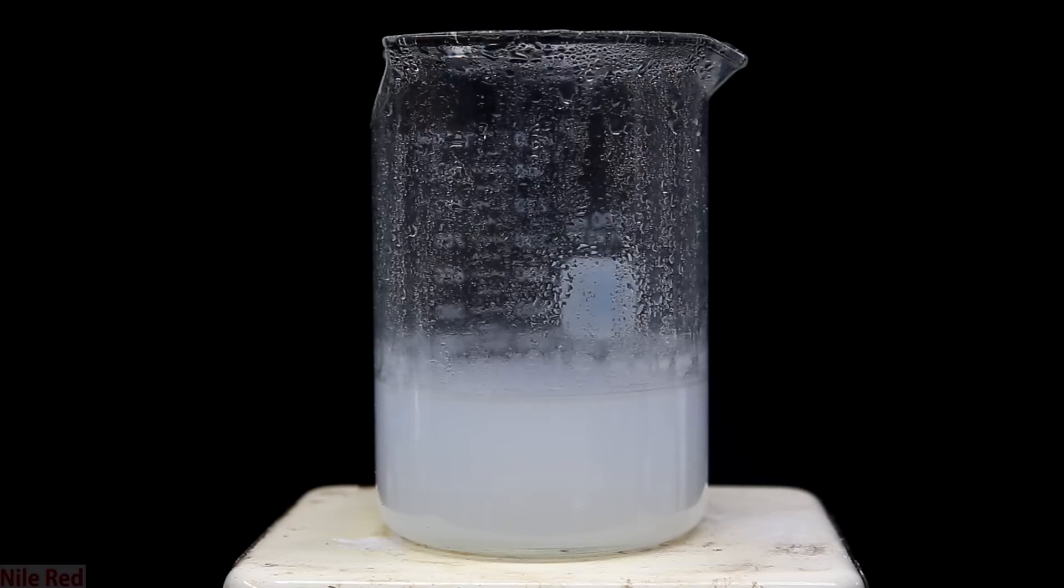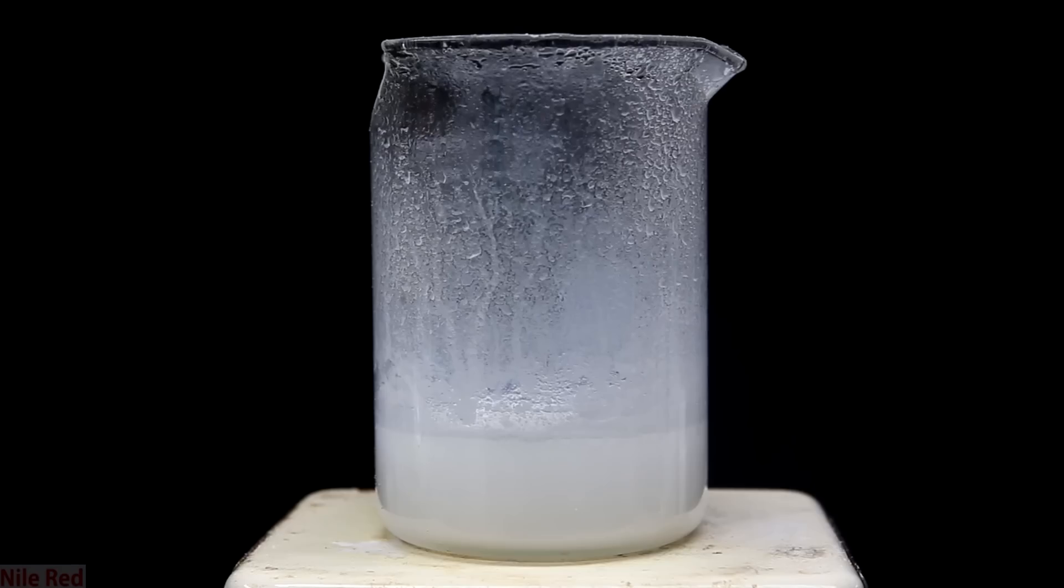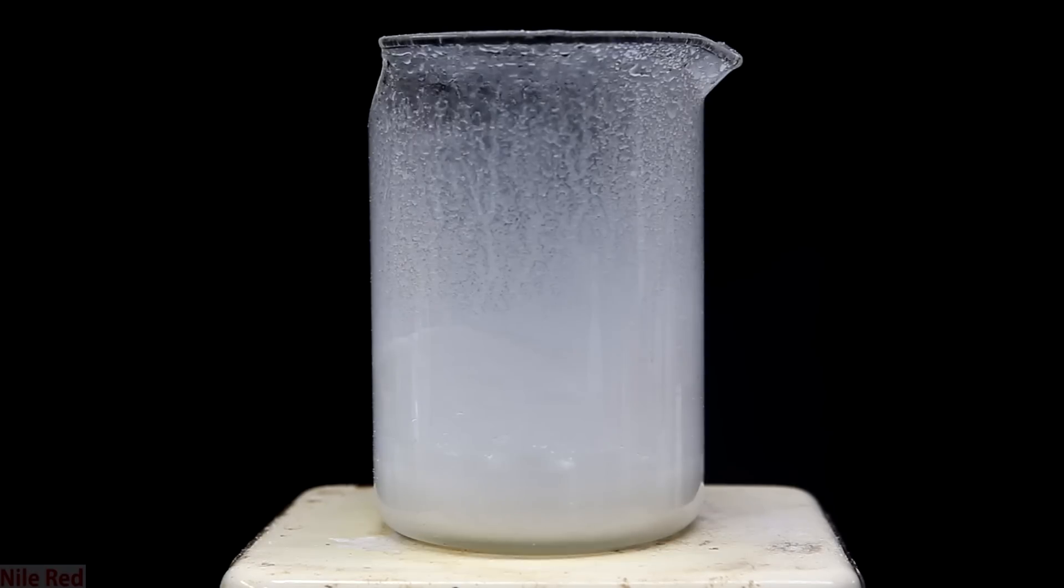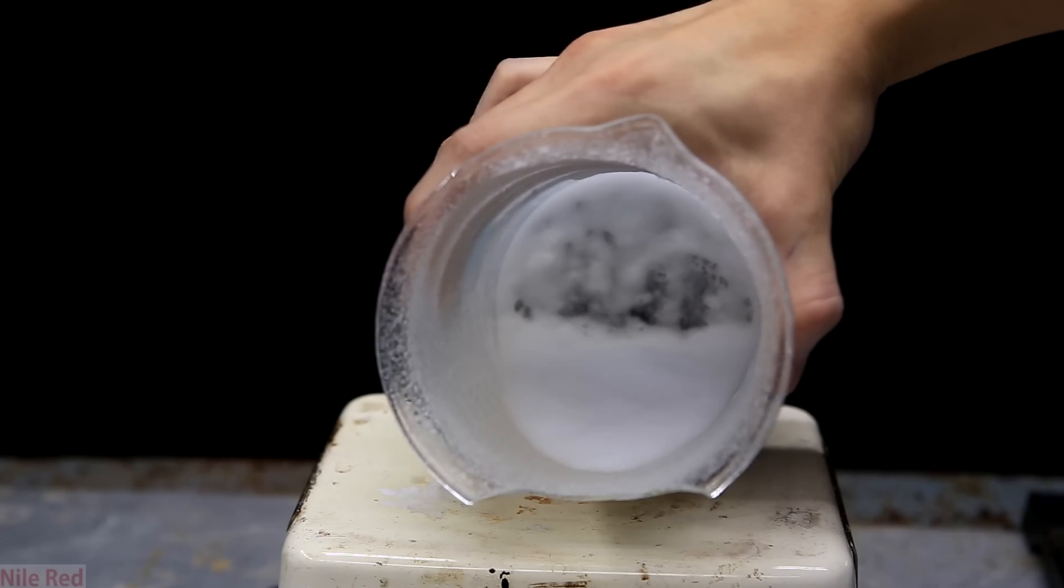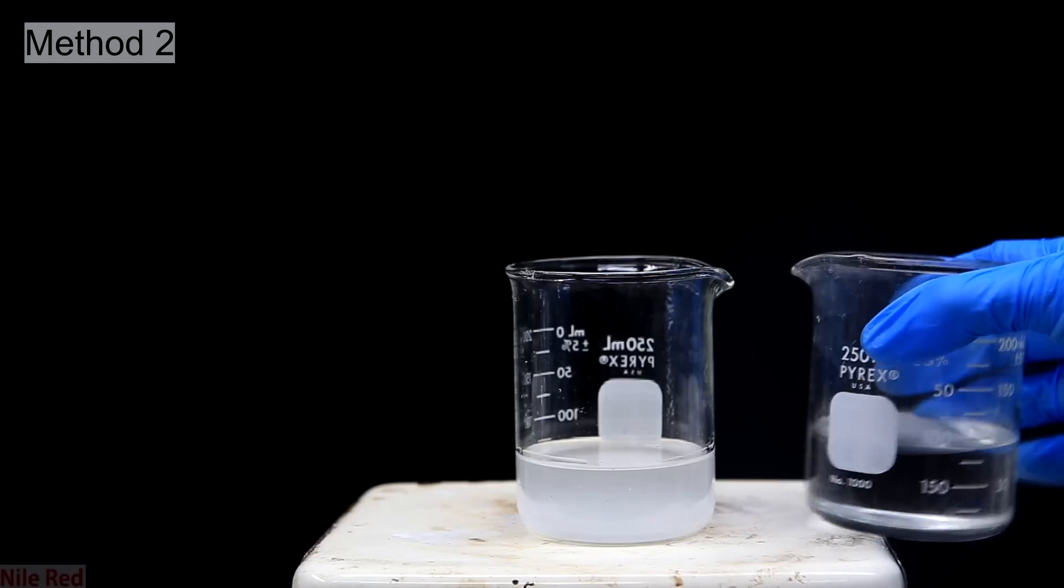But I think the one downside is that we're exposing solid lithium hydroxide to air. My entire idea of making the lithium hydroxide was that it could react with carbon dioxide in the air, so exposing it to the air like this at a higher temperature, it can react a little bit. This will produce lithium carbonate as a byproduct, which is going to be pretty hard to separate out. So if someone decides to go with the boiling route, this has to be kept in mind. Honestly though, the amount that it produces is probably so little that it doesn't really matter. In my mind, this method is much superior.